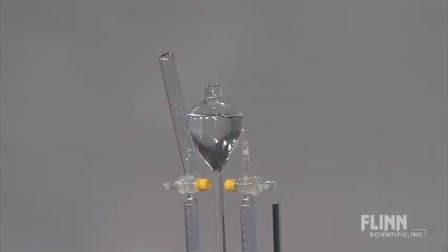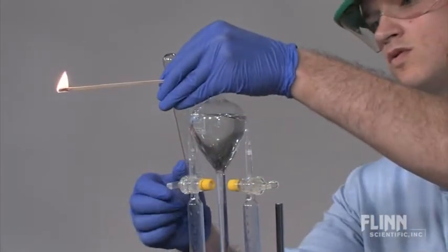Collect the gases by opening the stop cocks and allowing gas to flow into inverted test tubes for three to five seconds.